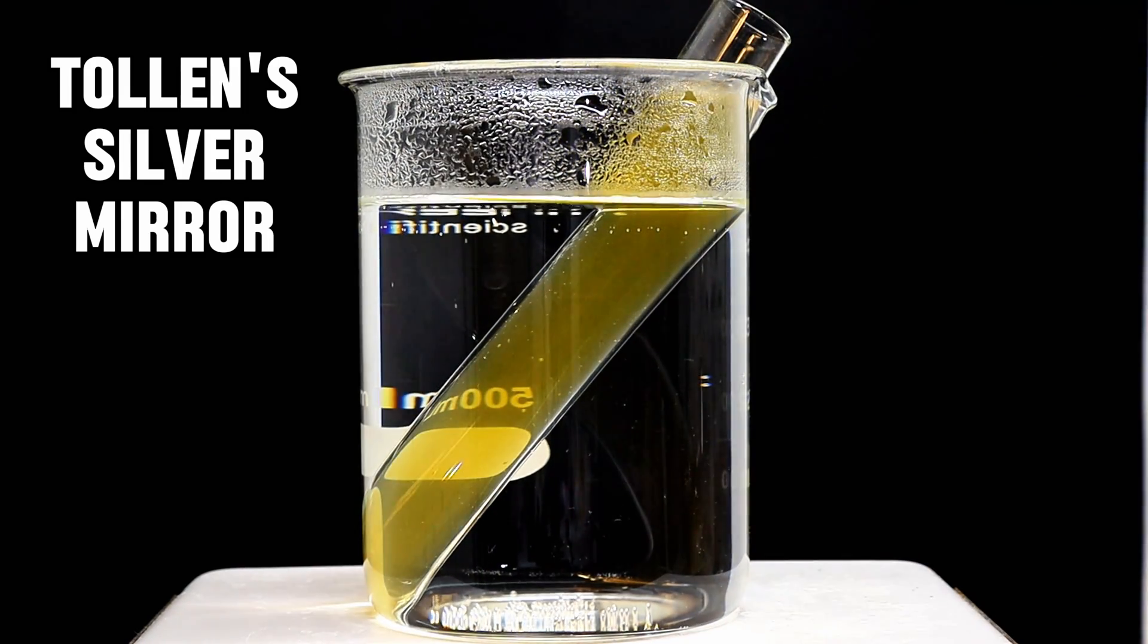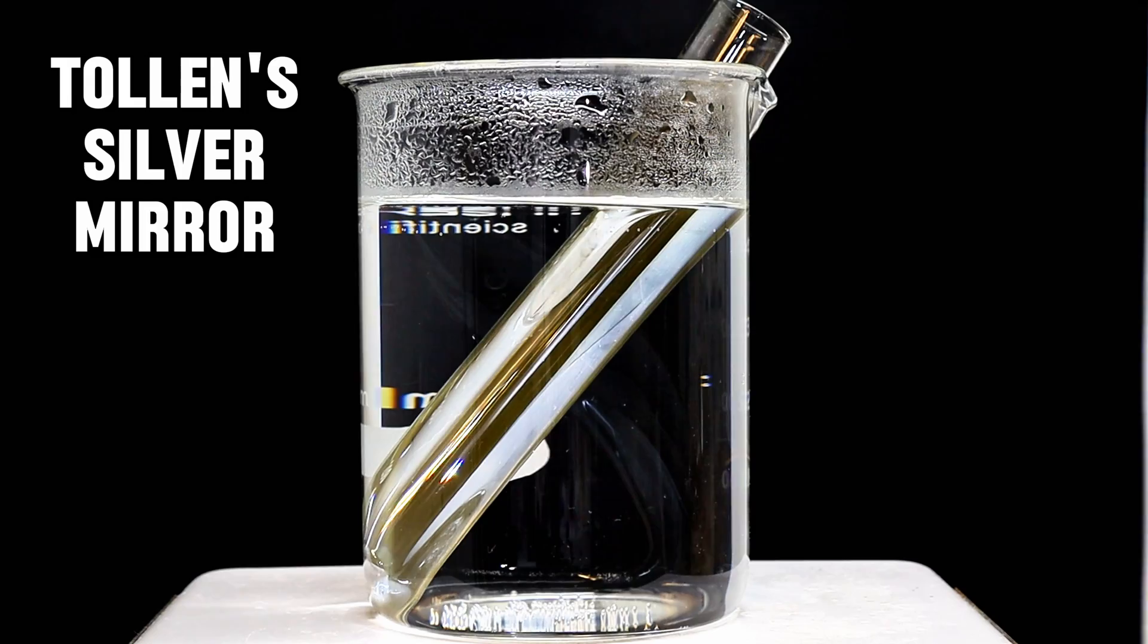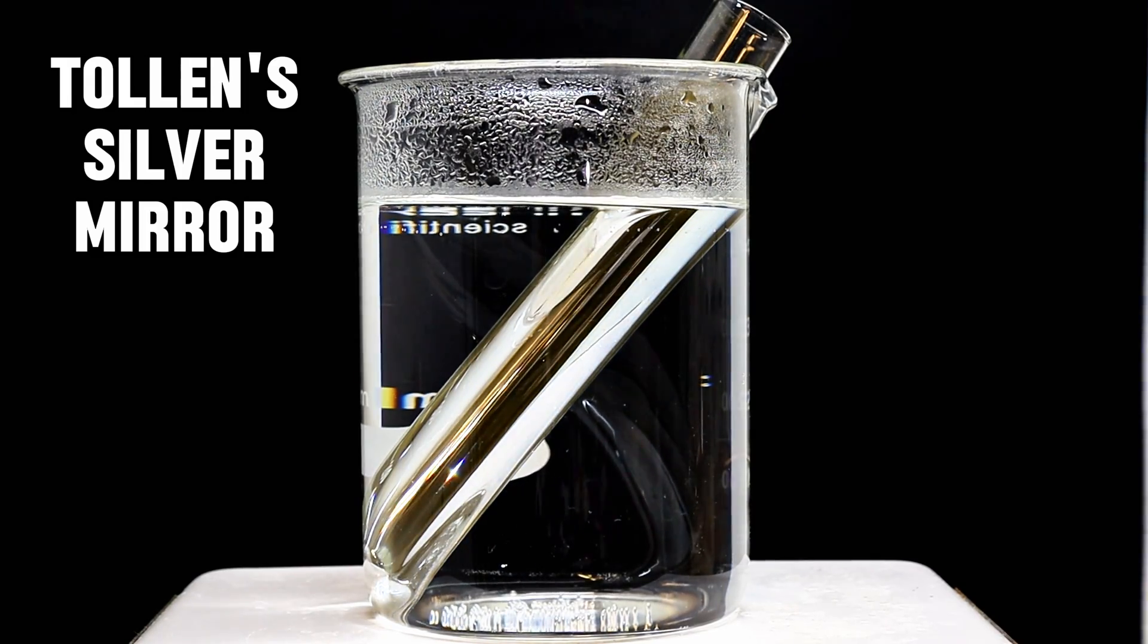Today I'm going to do the silver mirror reaction, which is one of my very favorite chemical reactions and one of the few that really got me into chemistry to begin with.